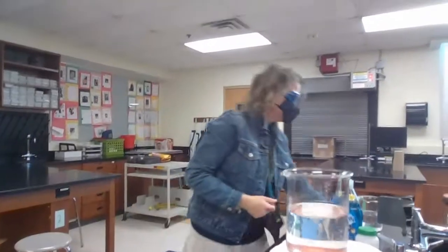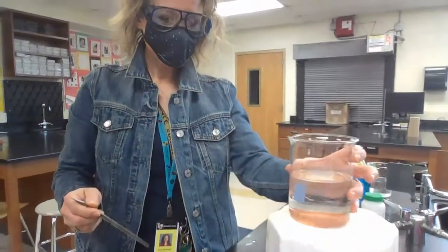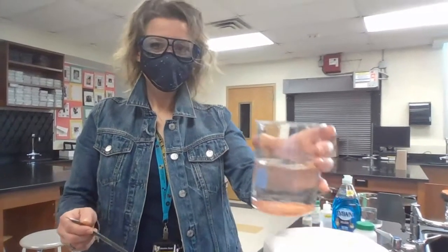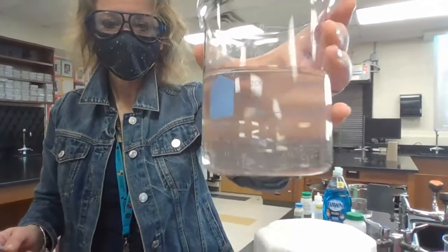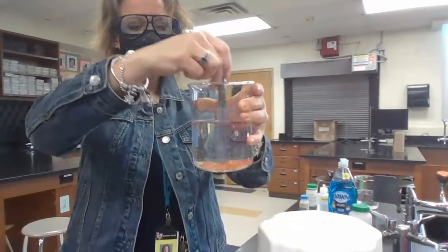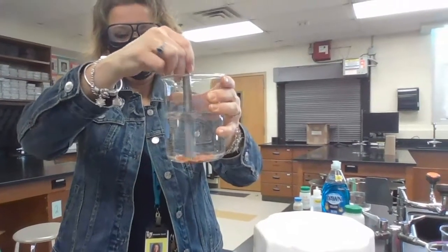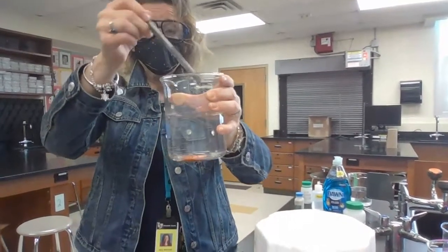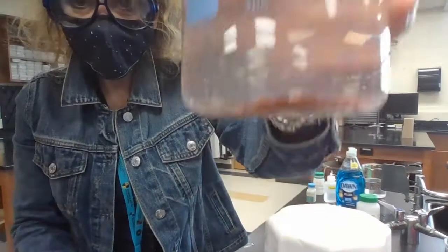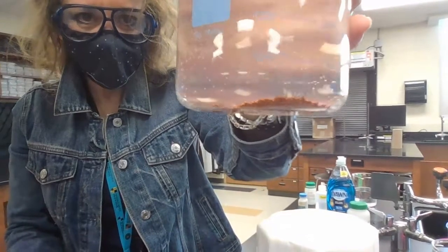Now, if you guys think about this a little bit, if you were walking around with pennies in your pocket on a rainy day, would there be a reaction? What do you think would be happening? Would you get fizzing going on and gases being released and fire happening? That wouldn't be a very good thing to have if you're carrying pennies in your pocket. Nope, it wouldn't. I thought maybe I could speed something up if I just stirred it, but nothing is happening.